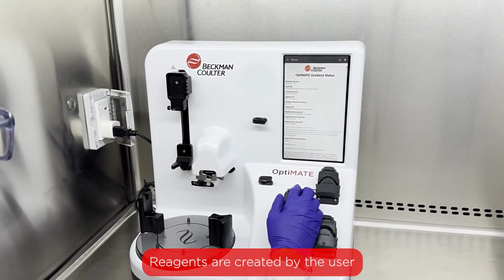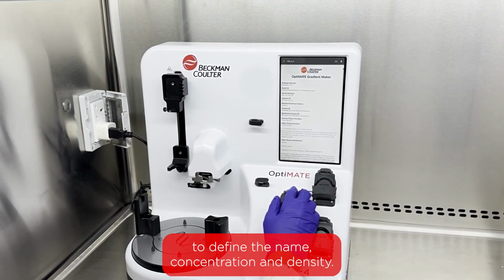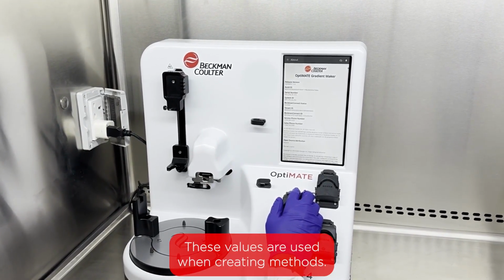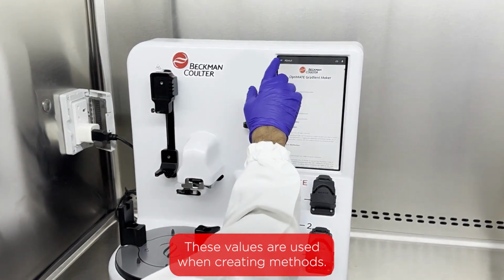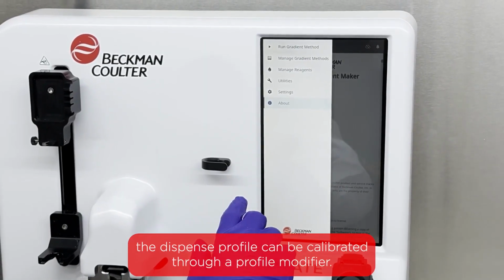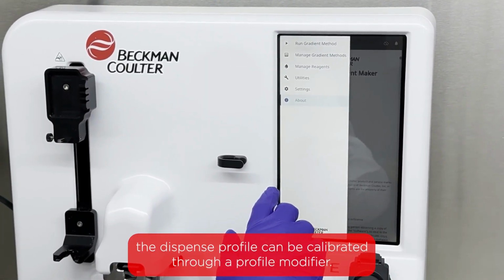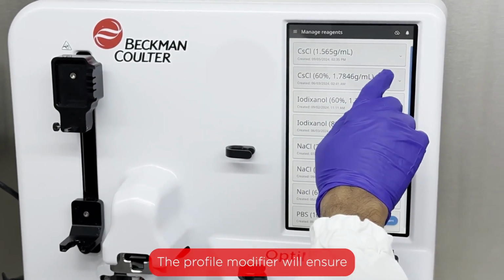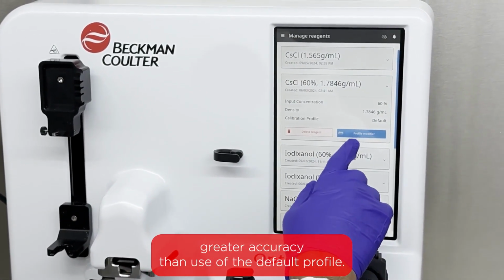Reagents are created by the user to define the name, concentration, and density. These values are used when creating methods. After the reagents are created in the software, the dispense profile can be calibrated through Profile Modifier. The Profile Modifier will ensure greater accuracy than use of the default profile.